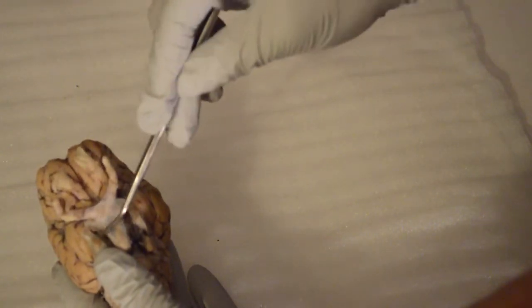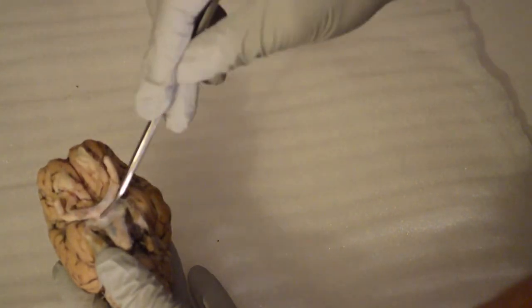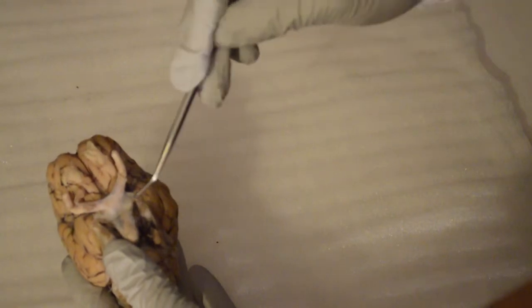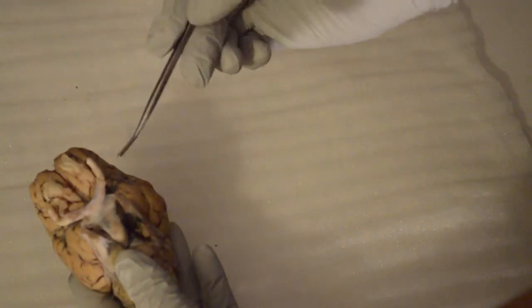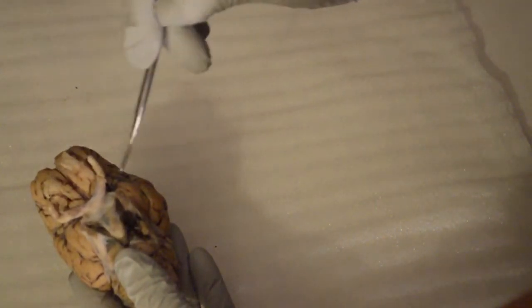Okay. Next, we'll move into the optic chiasm. The optic chiasm is the cross section at which the two meet here, and this goes into the left and the right side of the brain. Okay, and it goes into the visual cortex, which is the occipital portion of the brain, as discussed earlier. Next, we have the olfactory tract, which is right here. Okay, olfactory tract. The cerebral peduncle.